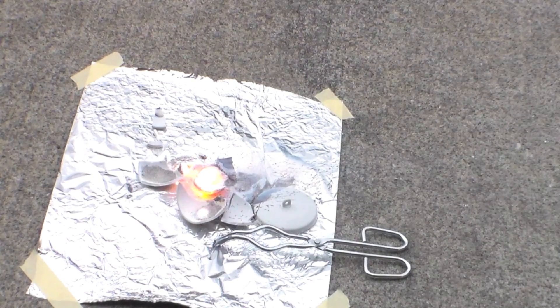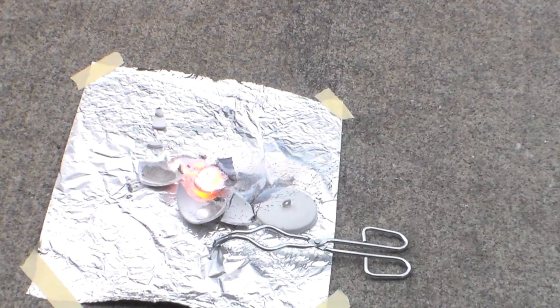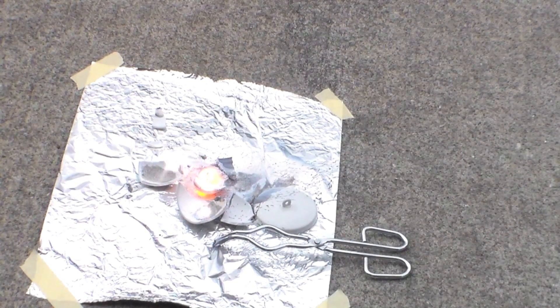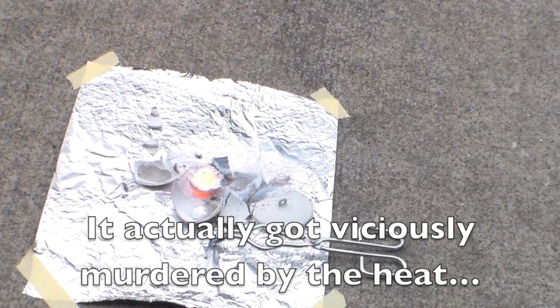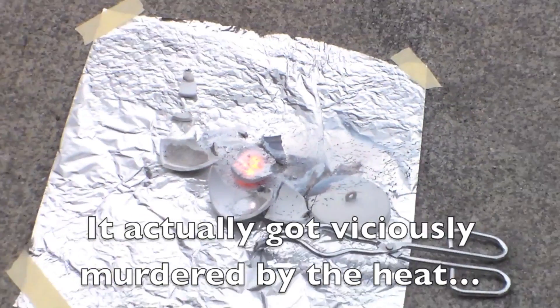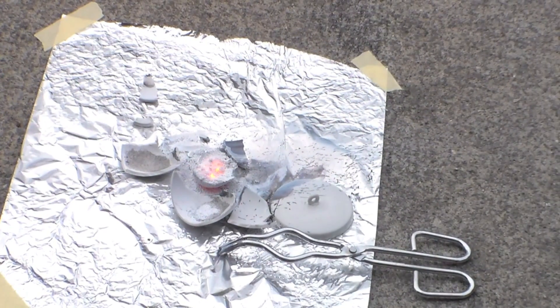Yeah, well, I wouldn't necessarily call this withstanding the heat per se. Maybe we can say the crucible coped with the heat. Anyway, here's a time lapse shot of the mixture cooling.